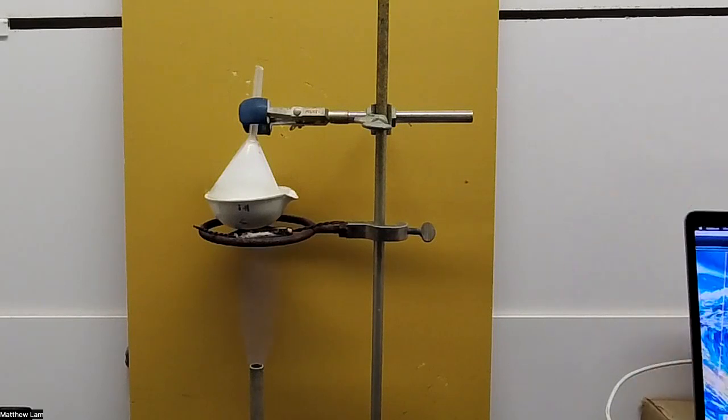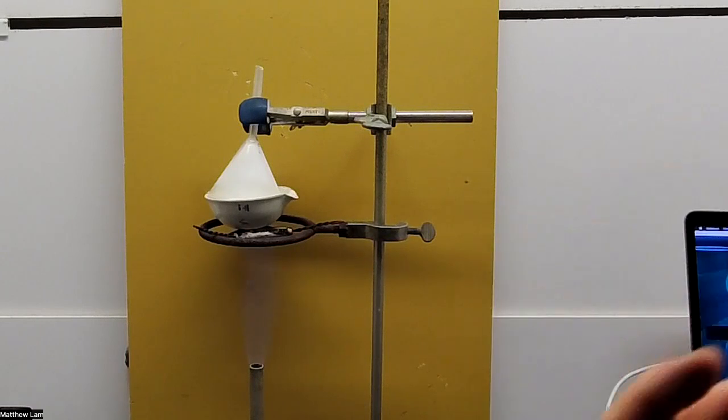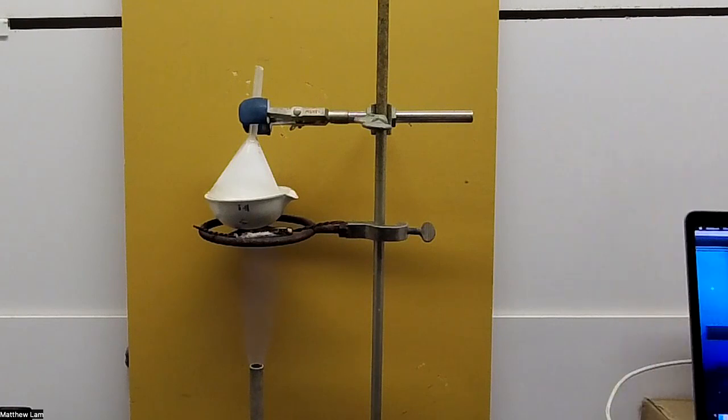I put kind of a different color background instead of white for this. And now, as you can see, the funnel is fairly white. So that ammonium chloride that was on the bottom of the evaporating dish has now sublime and is being caught into the funnel. Now, full disclosure, when I was setting this up, some of the ammonium chloride escaped out of the side. So we're not probably going to obtain all of it, but you get the concept nonetheless. We'll continue the experiment.